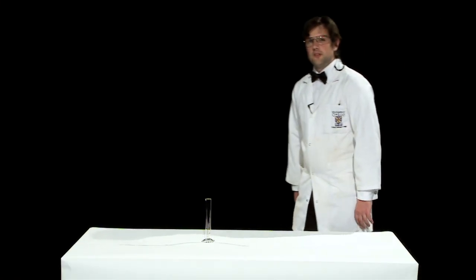Hello again and welcome back to the Otago Chemistry Channel. Today we're going to look at a couple of experiments that explore the properties of liquids.